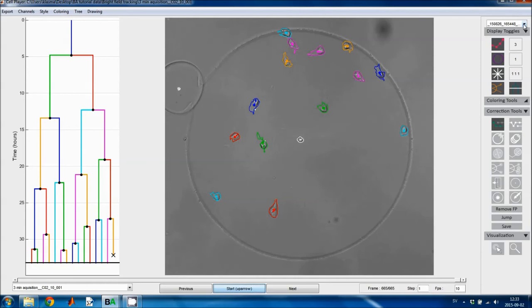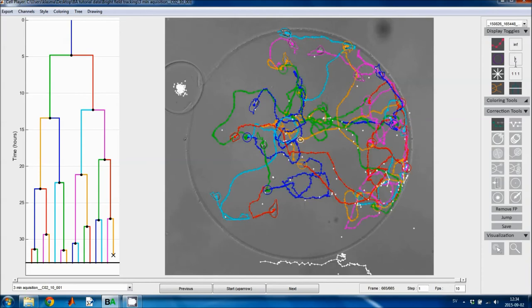On this top drop-down menu, you can select what tracking versions you want to open, and then these display toggles or display tools specify how you want to display the tracks. This first toggle button toggles the plotting of trajectories or tracks on and off, and the text box next to it specifies how many time points back in time we should plot the tracks. In this case it's 3, but we could also do 10, or we can specify infinity, inf, which means that all of the prior time points are plotted.